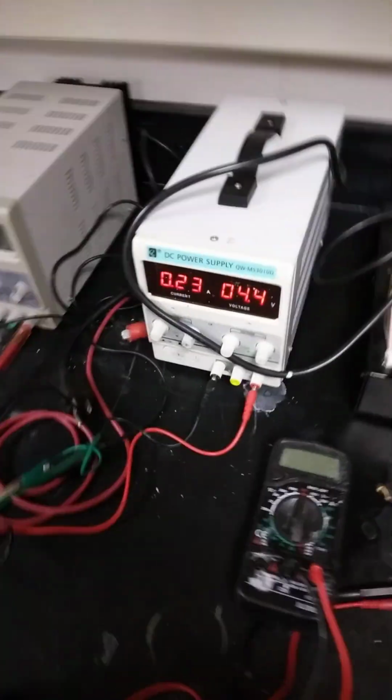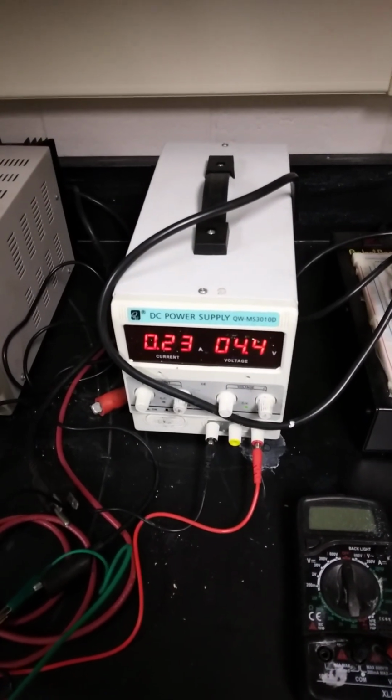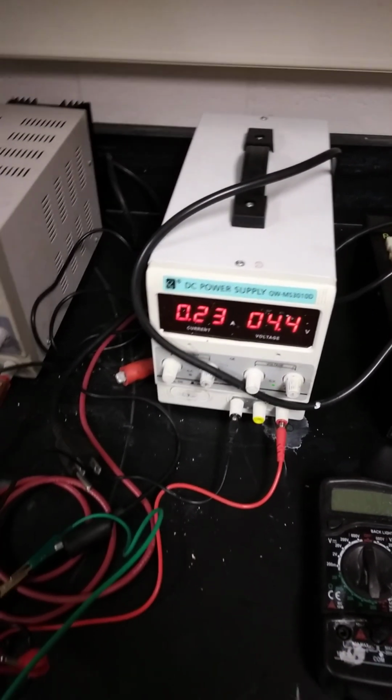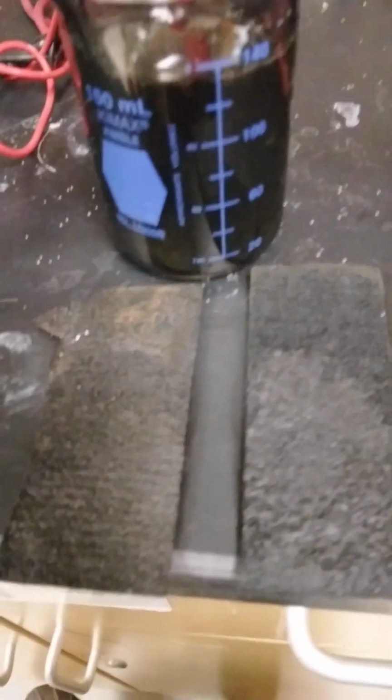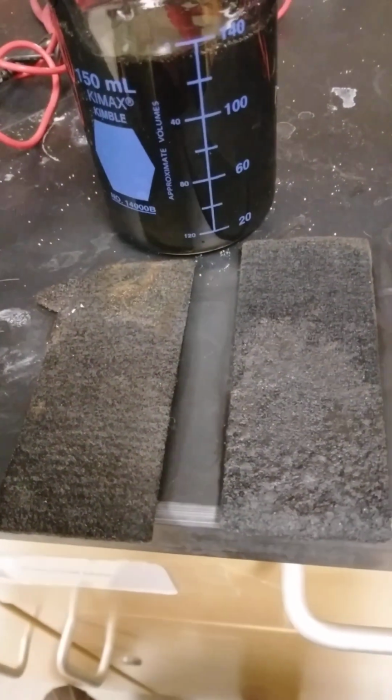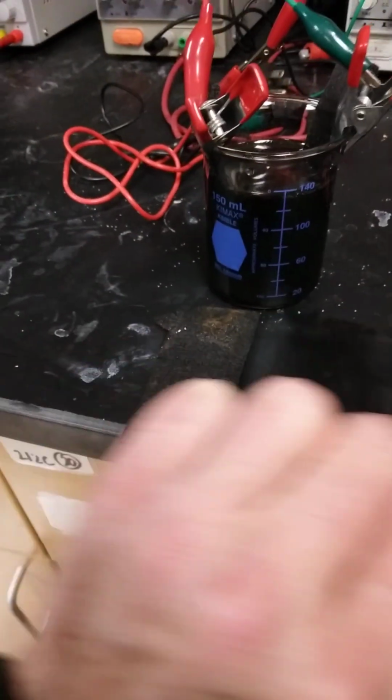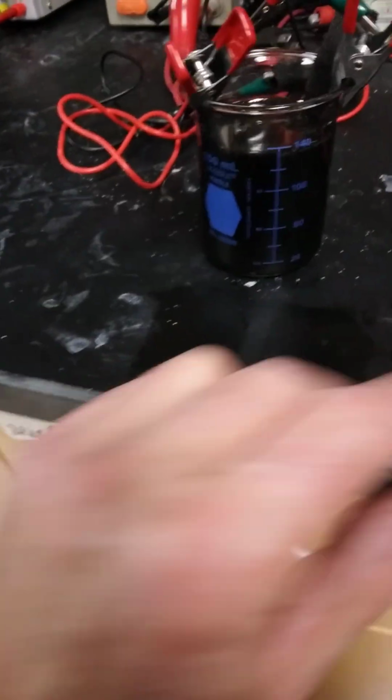Okay, right now I have this set up with a power supply. I'm drawing 230 milliamps at 4.4 volts. Even at 2.3 volts, I was seeing evolution. Here's a couple of these pads. These two have way too much material on them. And the ones that are in there, much thinner.